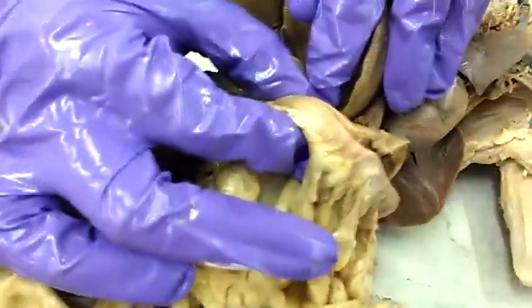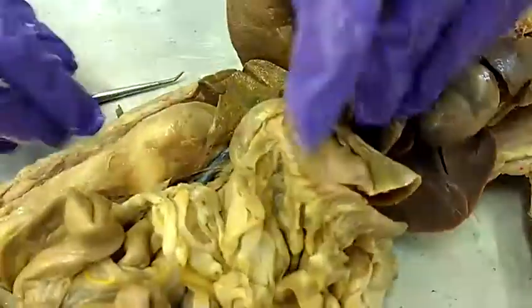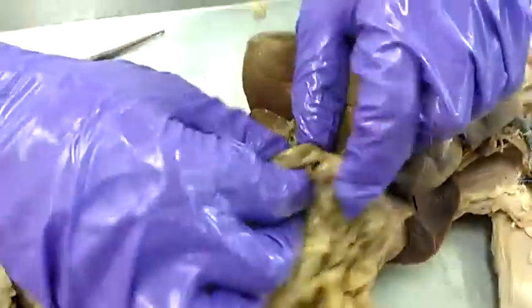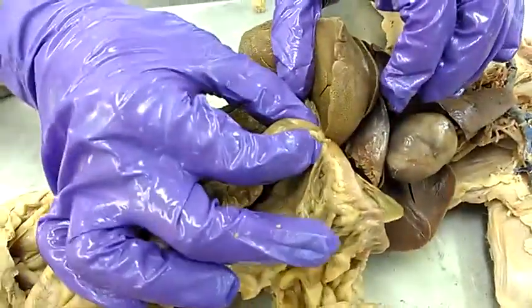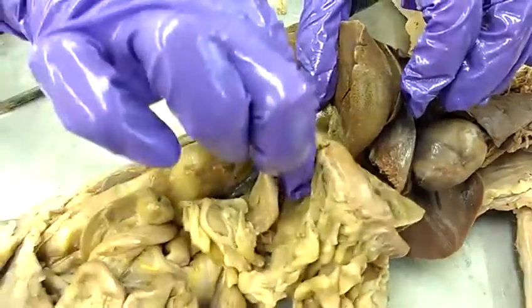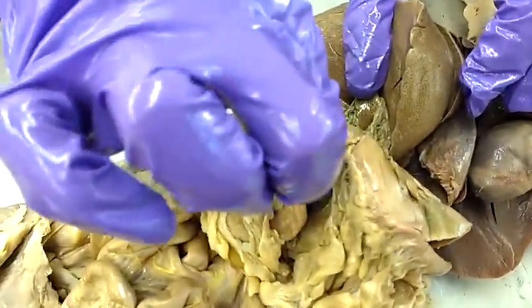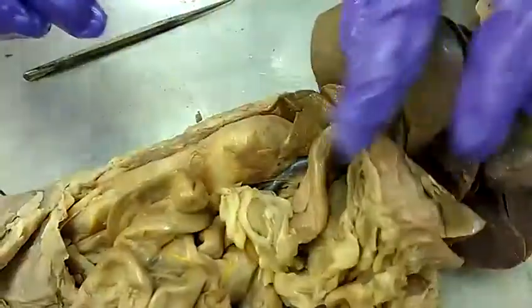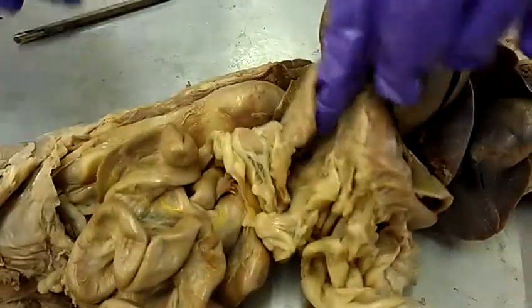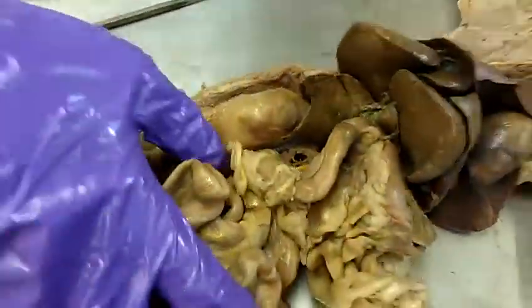That is the pylorus. And then right below, going into the duodenum, is the pylorus, and that's the duodenum. The first part is the duodenum.